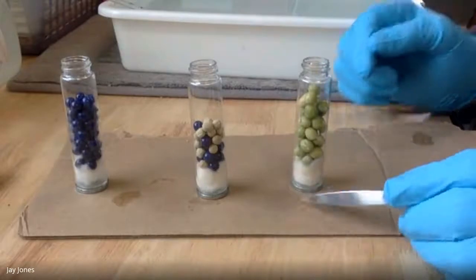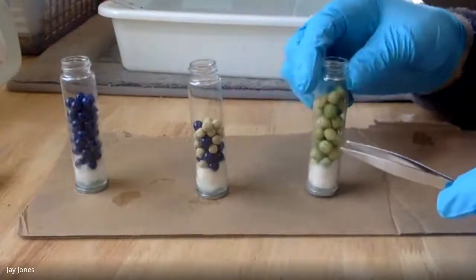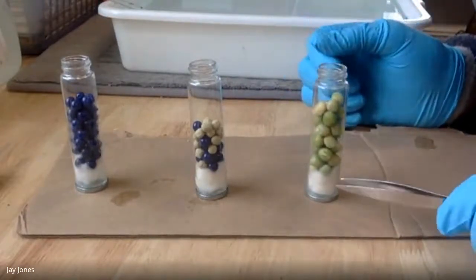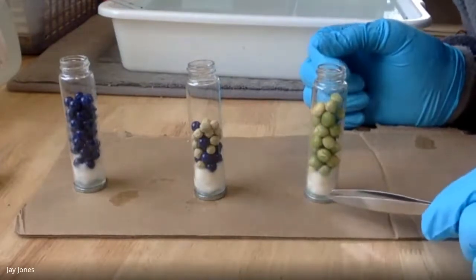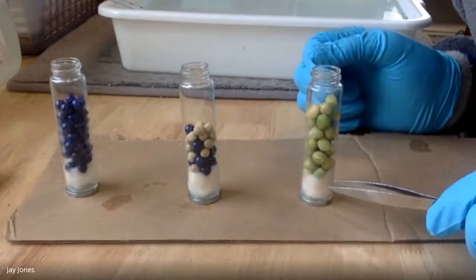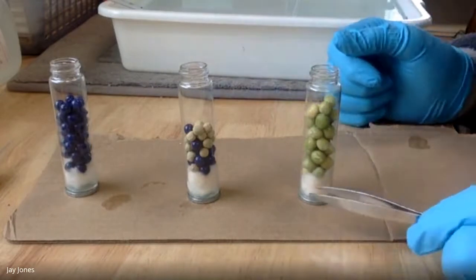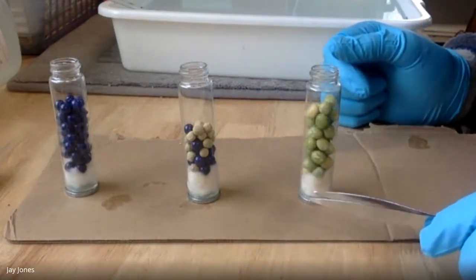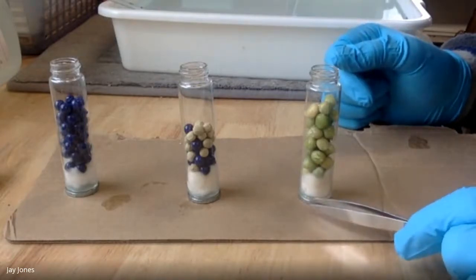You can see there are glass tubes, they're weighted. There are peas, Alaskan snow peas, in one. Then there's cotton, and the cotton is actually of 2 types. On the bottom is cotton soaked in potassium hydroxide, KOH, in solution. Above that is a protectant cotton, just non-absorbent cotton. So basically the cotton has KOH.